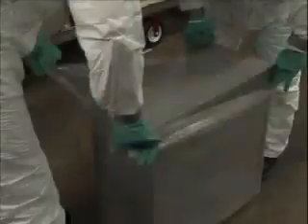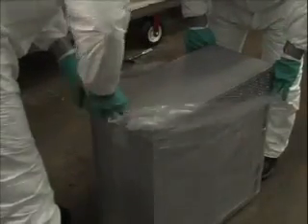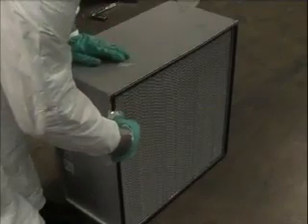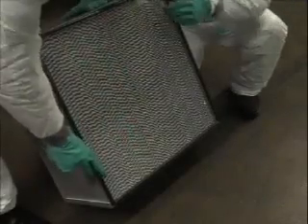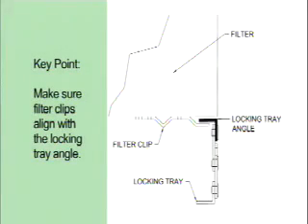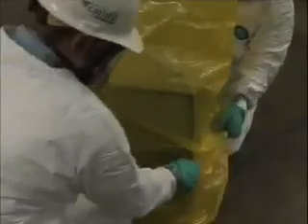Unpackage the new filter in accordance with Camfil Farr's instruction. If installing a gasket seal filter, apply a thin layer of silicone grease to the gasket area. Place a new change-out bag over the new filter to be installed. If installing a fluid seal filter, make sure the new filter is oriented so that when placed inside of the filtration housing, the filter clips will align with the locking tray angles.